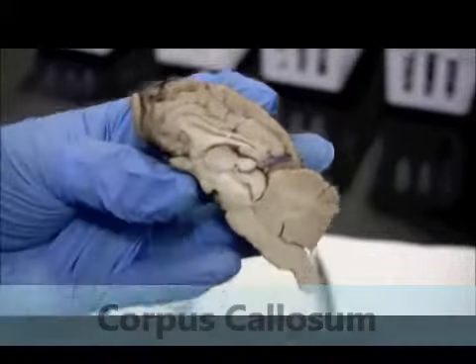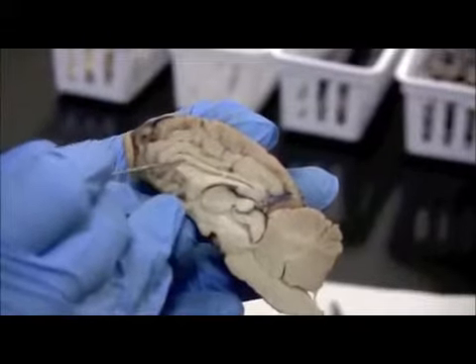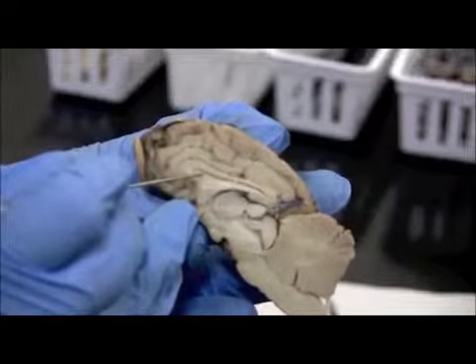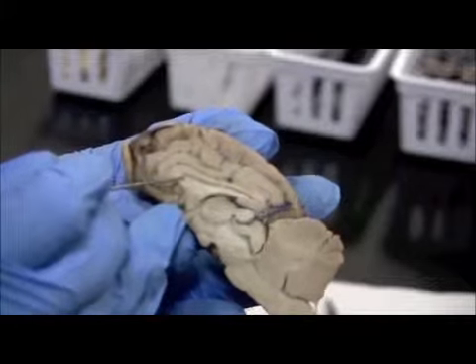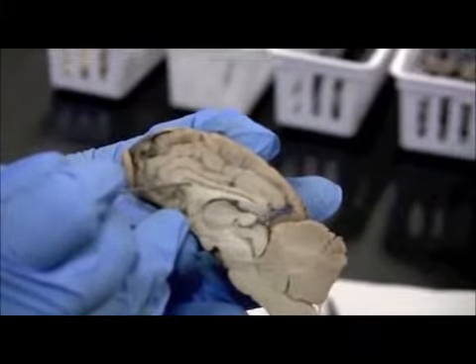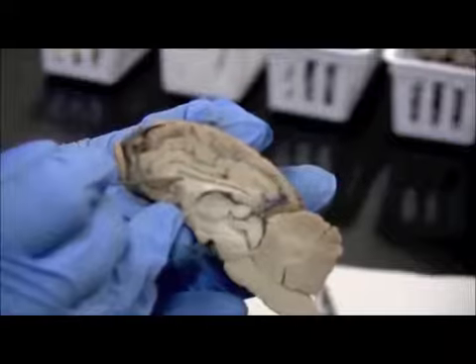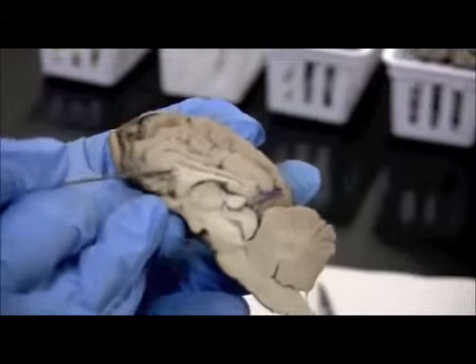And this membrane right here, it's a very thin membrane that's covering this hole, is actually the partition between the 2 lateral ventricles, the left and the right lateral ventricle. It's the septum pellucidum, and there's little holes in there, the interventricular foramen, that actually allow the cerebral spinal fluid in the ventricles to pass through. I'm going to tear through it so you can see how thin it is. Just a little membrane.